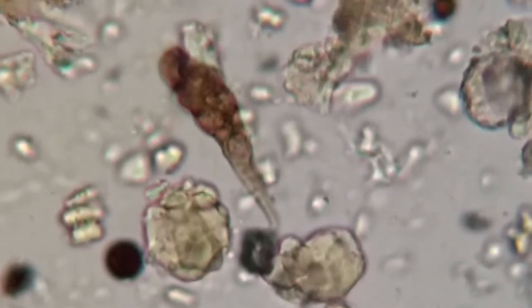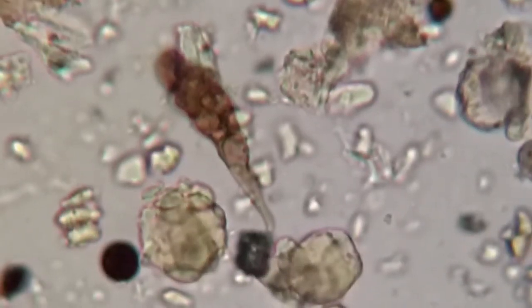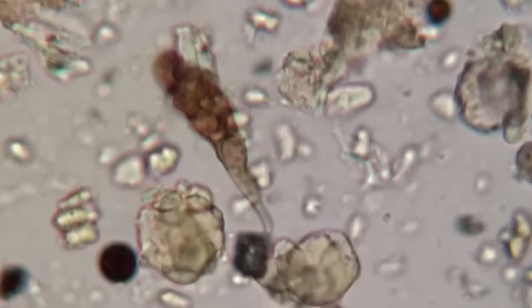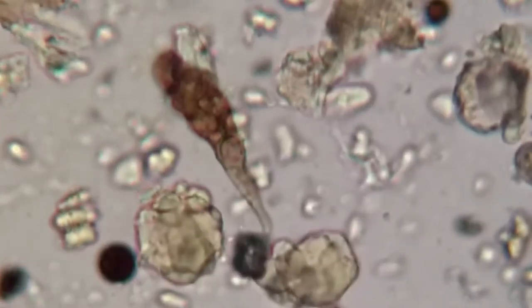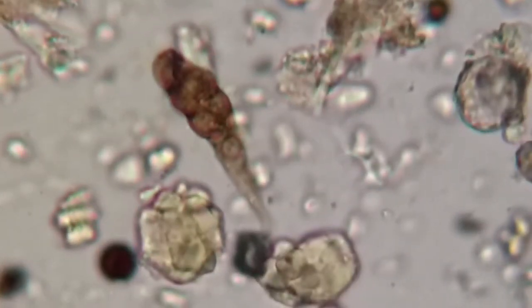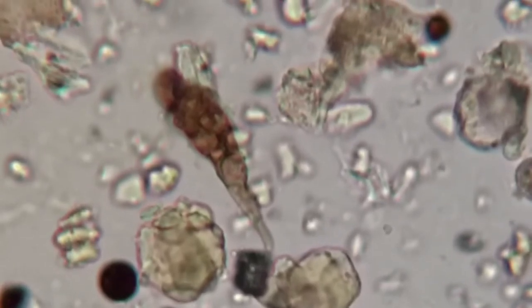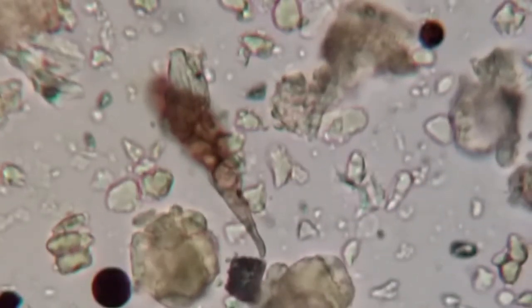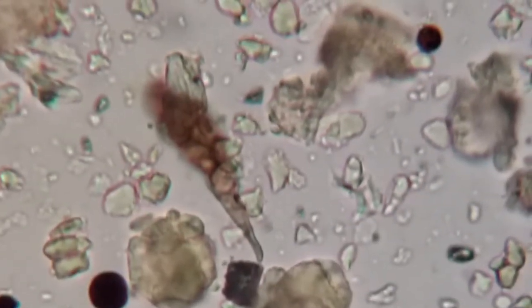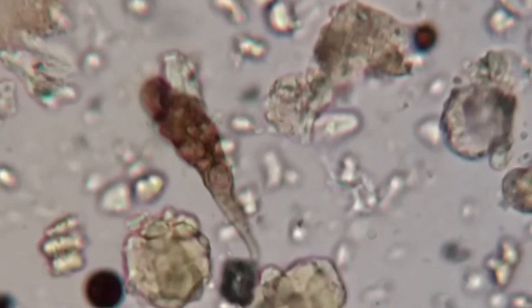We can zoom into that and you can see that there are a group of cells at the top and then kind of a large tube coming out of it — a sign that it's germinating and getting ready to grow.